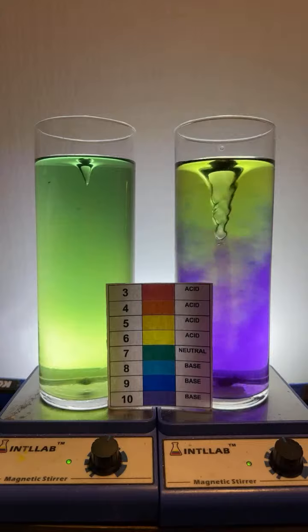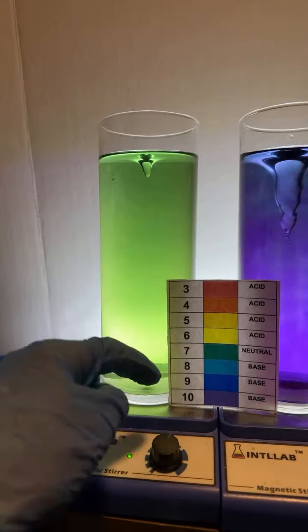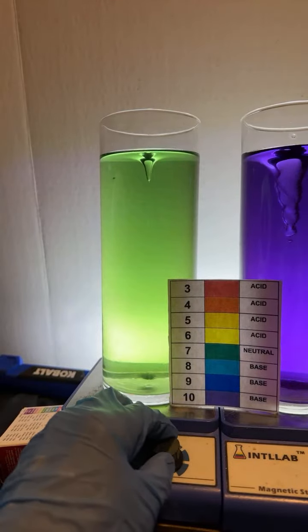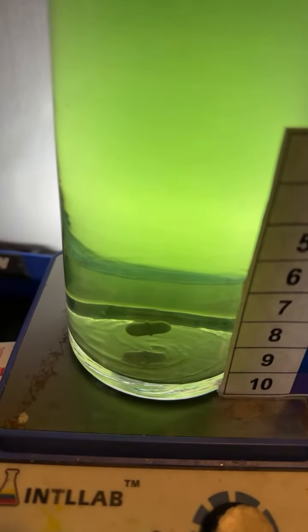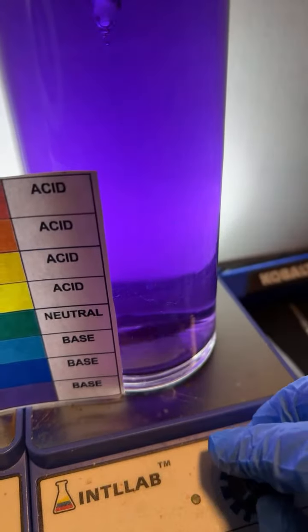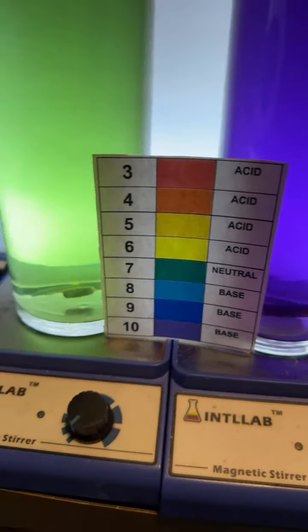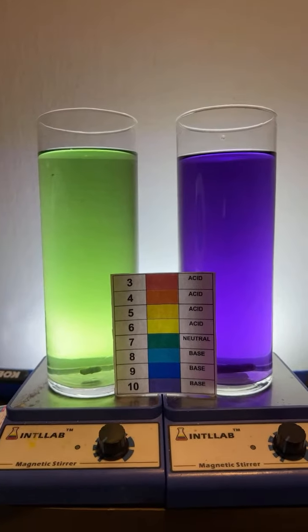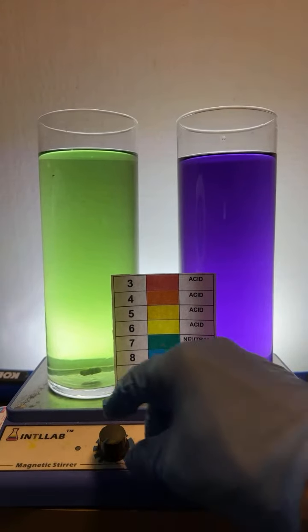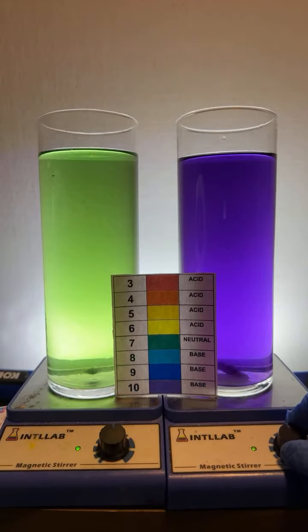Why is the vortex so much smaller on the left? Asked Random Brain Cell. Let's check it out. I'm going to turn off the stir bar down here. All right. I want you to look at the size of the stir bar in this one. And then I'm going to turn off the stir bar over here on the left and look at the size of that one. So you can see the stir bar on the right is much larger than the stir bar on the left. And that's what gives them different sizes. I'll go ahead and turn them on at the same speed. So I'm going to go ahead and turn them halfway on both.